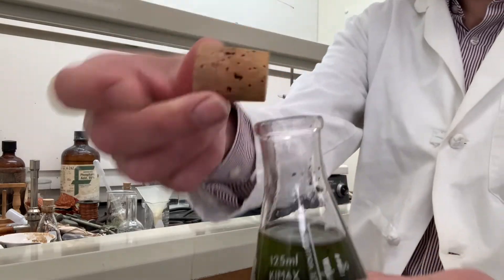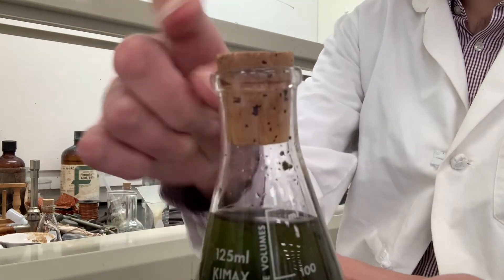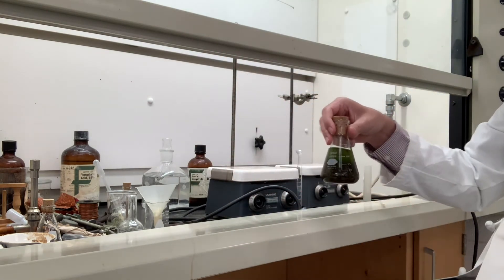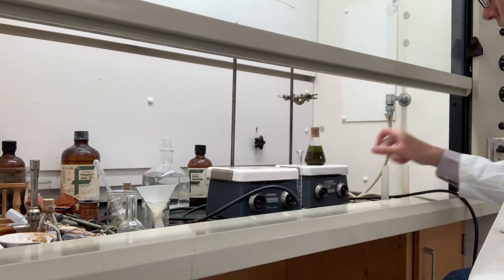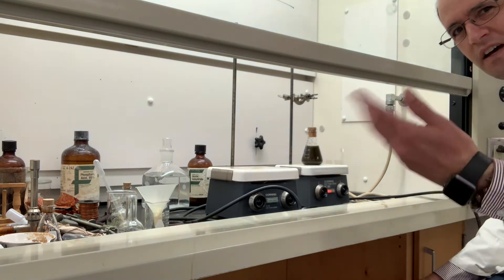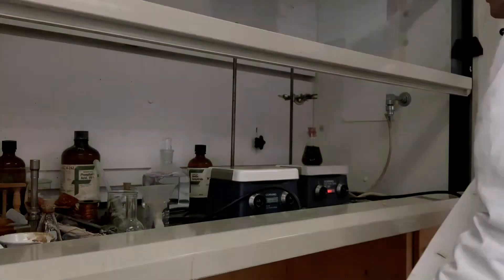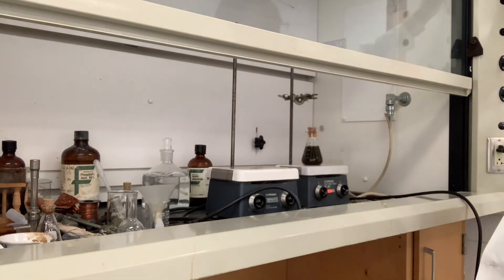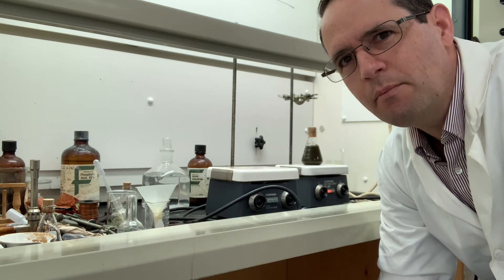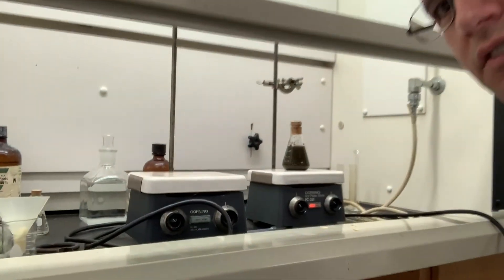I found a cork, but it's dangerously close to falling in — you'd want a little more height on it. There's a magnetic stir bar in there, so at room temperature we'll get this stirring. Getting stir bars going can be tricky — you don't want to go too fast all of a sudden. I could not find my aluminum foil, so I'm just going to turn the light off in the room. I'll come back after a couple of days and show you what it looks like.